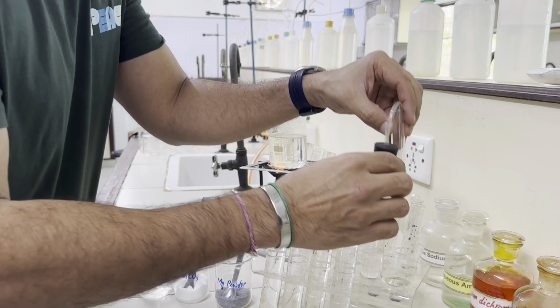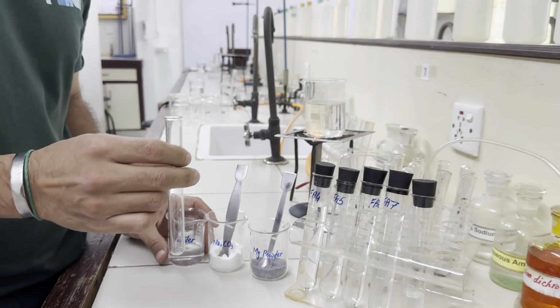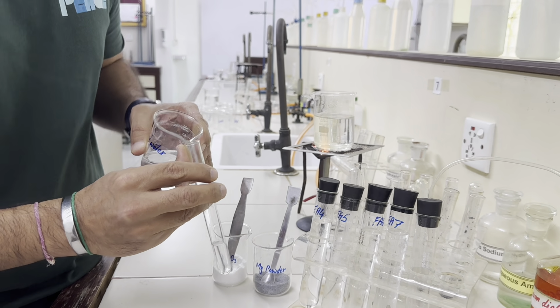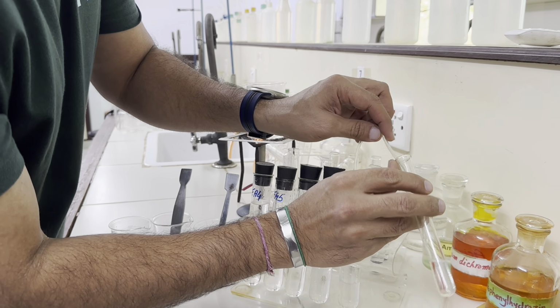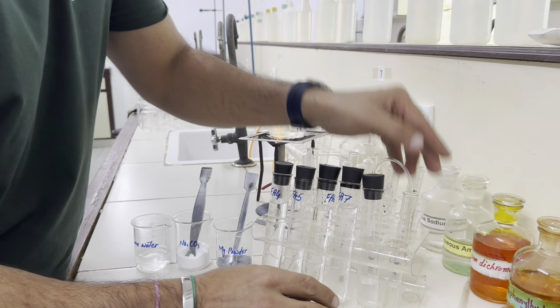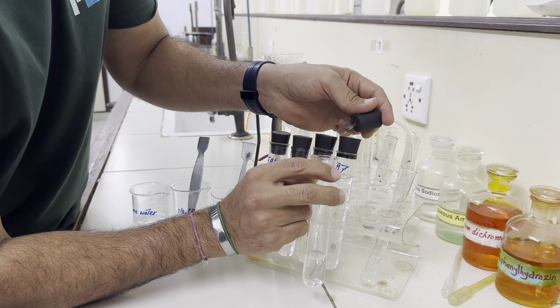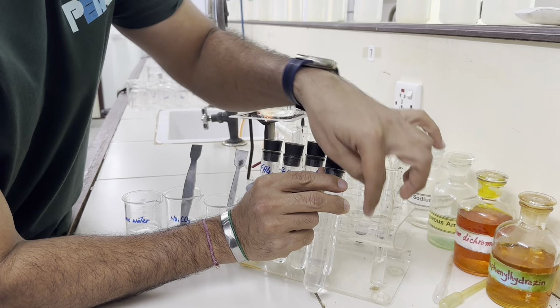So in this test tube we will pour the lime water first. So here we have lime water. We will take a small amount of lime water in the test tube, and we will put this delivery tube through this lime water. And now, once I add sodium carbonate in this tube, I will quickly put this rubber bung over the top so that the gas given off quickly passes through this test tube.